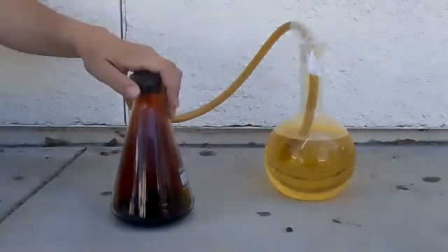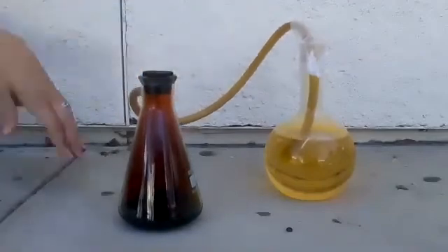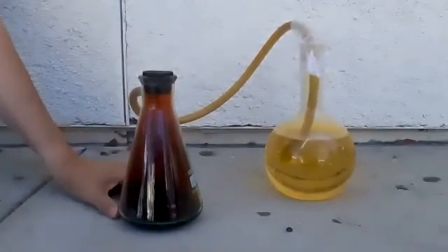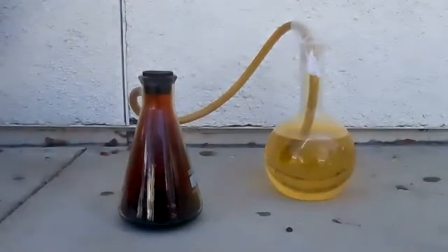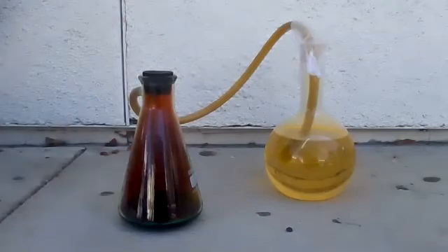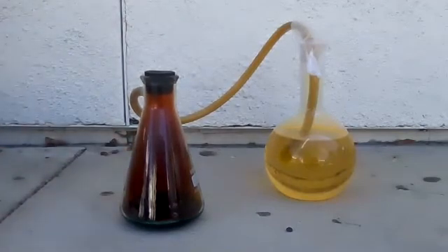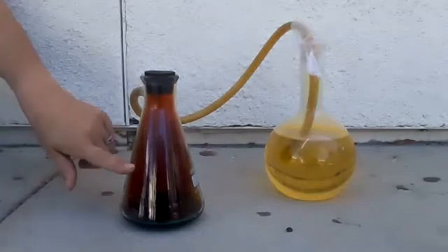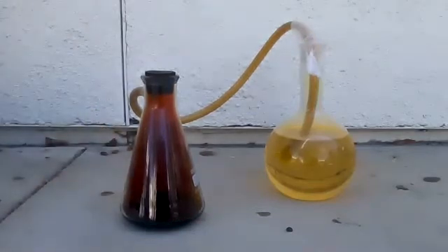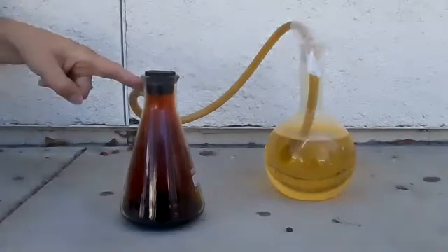What do you think is going to happen if I put this in an ice bath? This is good glass, it can take it. But if I cool off the gas, it's going to contract.